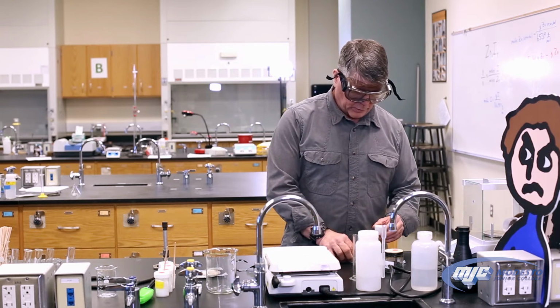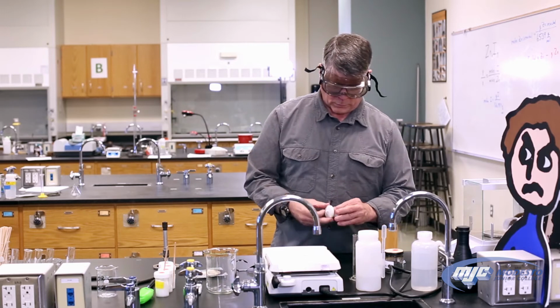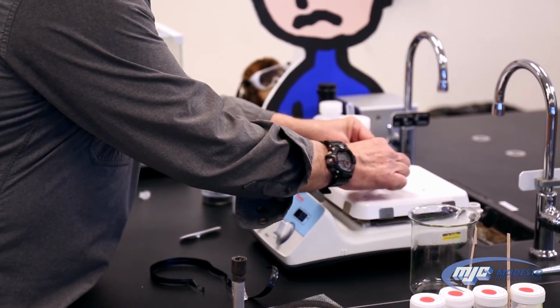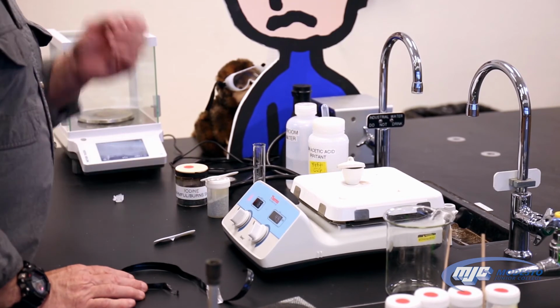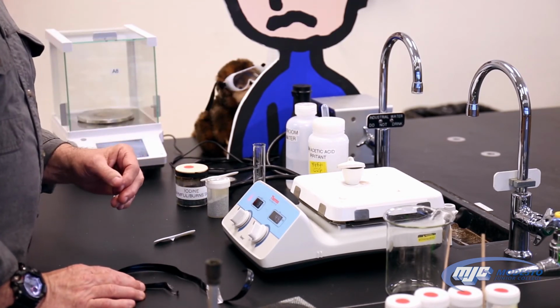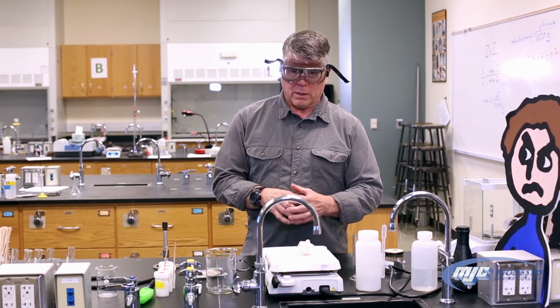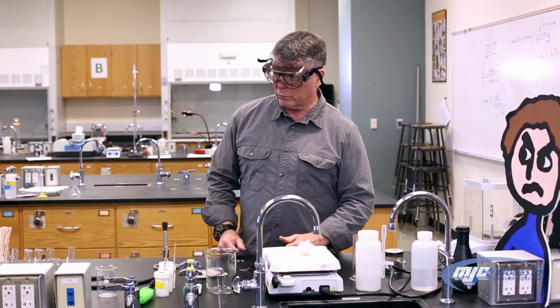Now what we do is we take the crucible lid, put the cover on, leave a little crack, just like that, and place it on the hot plate. The hot plate should be turned up about halfway. And we have to keep our eye on the crucible for the first 5 minutes pretty carefully, because what happens sometimes is as the water molecules start vaporizing and leaving, they form these bubbles that pop, and then stuff starts shooting everywhere, and we want to avoid that.